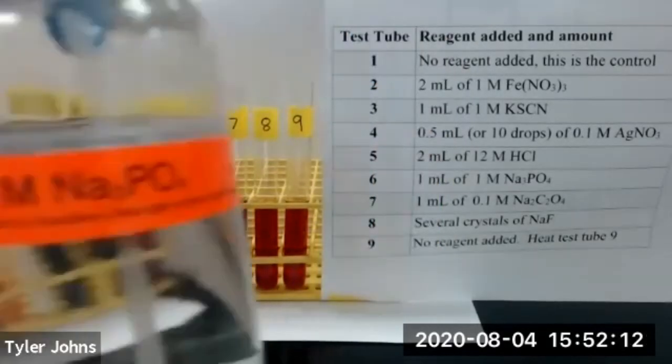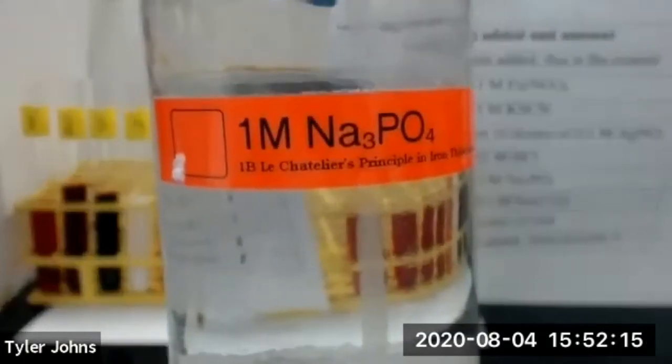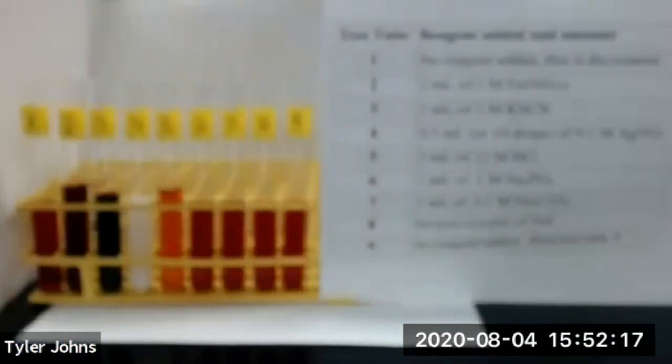We'll now add one milliliter of trisodium phosphate to test tube number six.